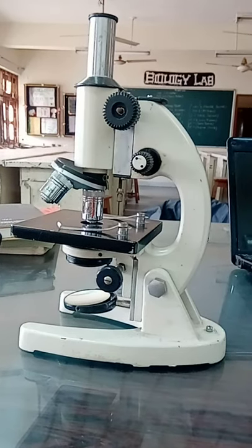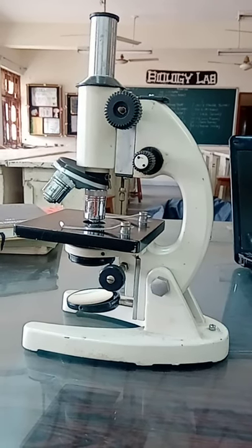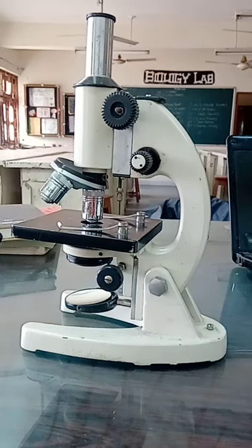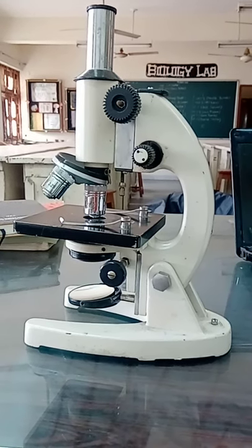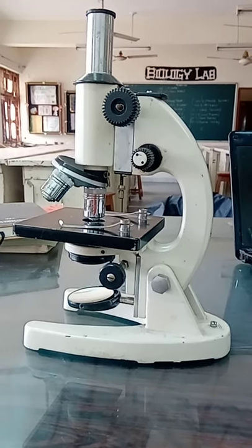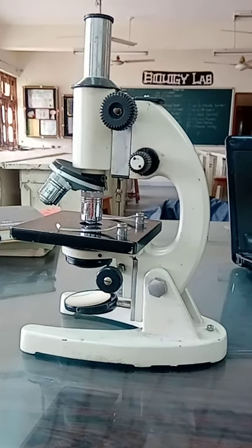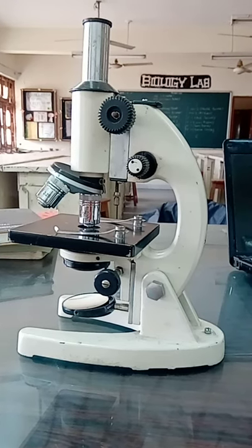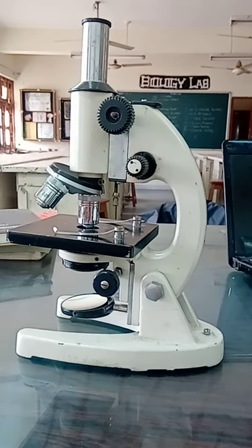Hello everyone. As per your syllabus, we are going to discuss the different parts of the microscope. All the parts of a microscope can be divided into two categories: number one, mechanical parts, and number two, optical parts.